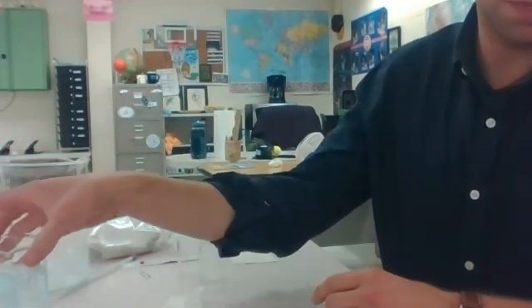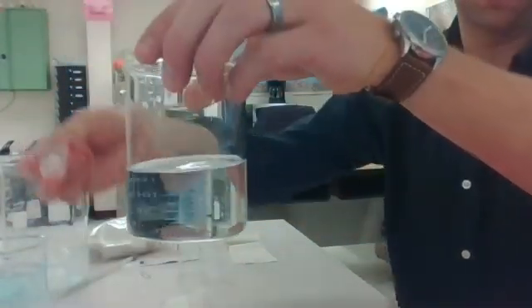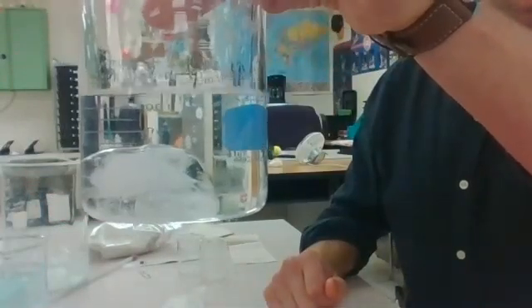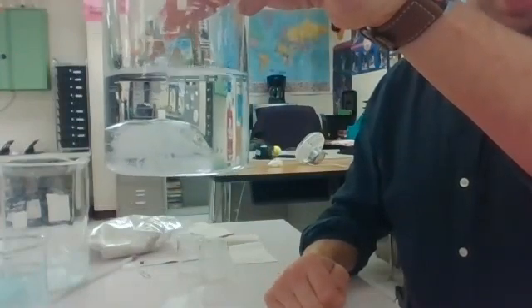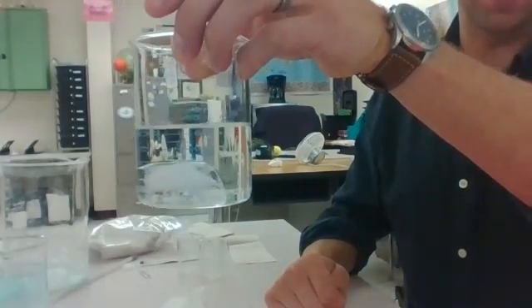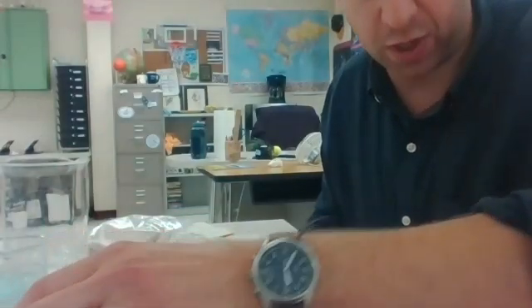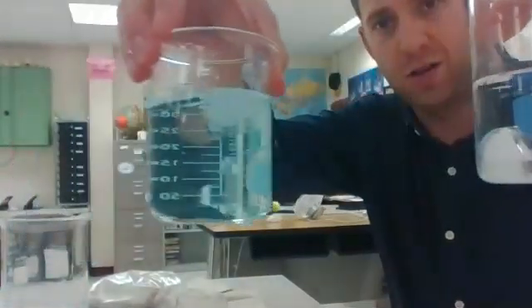In comparison, alcohol, ice, and we see that the density of ice, even expanded water, is still more dense than alcohol, hence why it sinks. Okay, looks like you have 2 questions for this station. Again, ice in alcohol, ice in water.